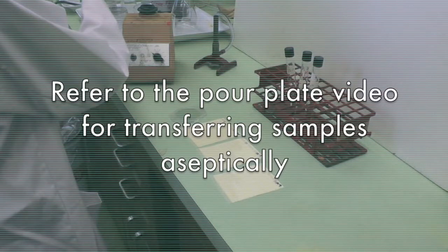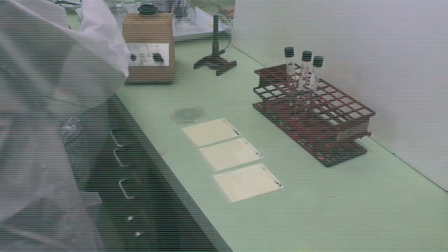If you are not familiar with how to aseptically transfer a solution, please watch the video on pour plate.